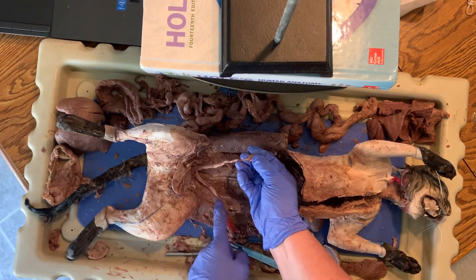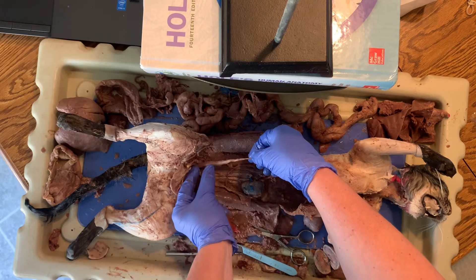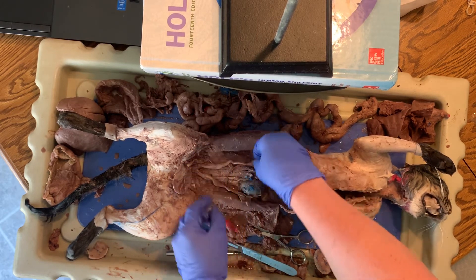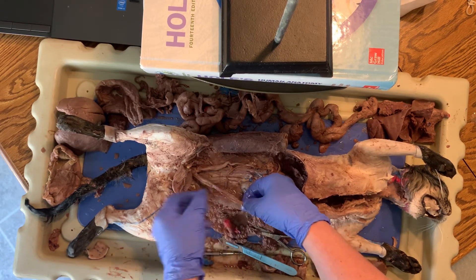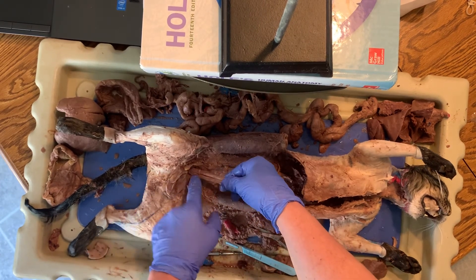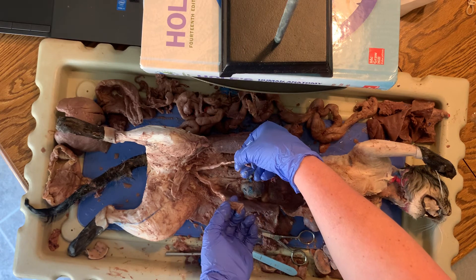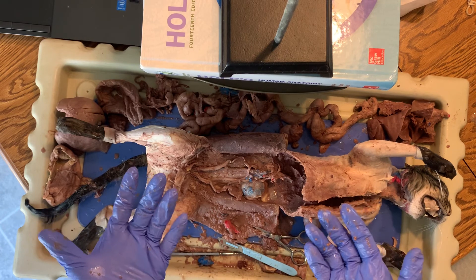These are the uterine horns, and when the female cat gets pregnant, the kittens actually start developing right in here. They might have three or four baby cats on this side, and it gets real big, and three or four on this side as well. That eventually leads to the vagina and outside of the cat, which can also be the birth canal. So there are a few differences between the cat and human female reproductive systems.